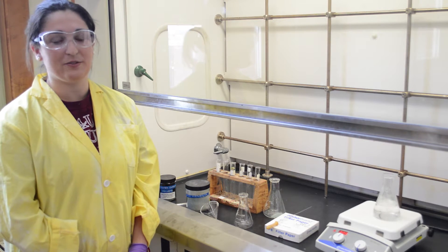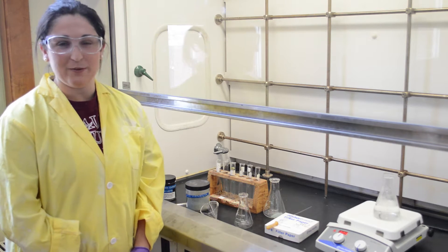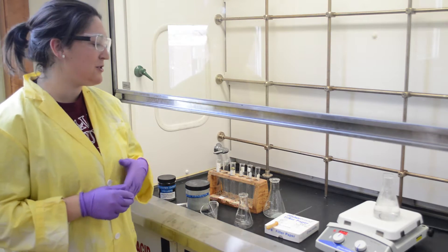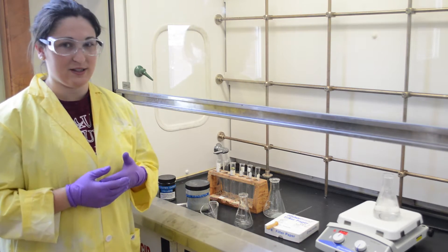Crystallization is used to obtain a solid product from a solution. Unfortunately, when we do this once, sometimes we obtain impurities within the crystals. In order to avoid this, we do a recrystallization.